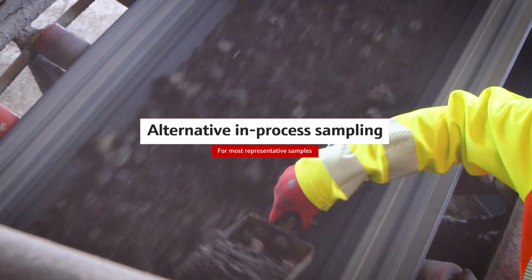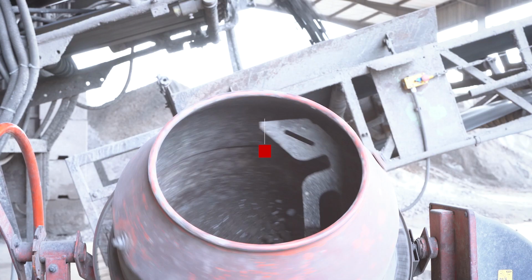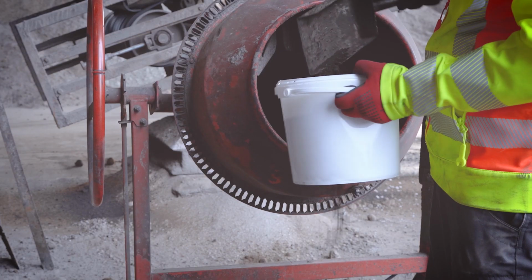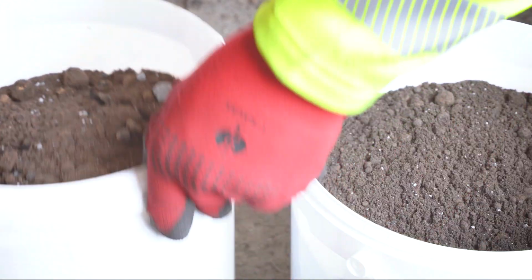In-process sampling can be done directly from the conveyor belt in time intervals. Sample mixing is done by a concrete mixer. This alternative approach generates the more homogeneous and representative lab sample, shown here on the right.